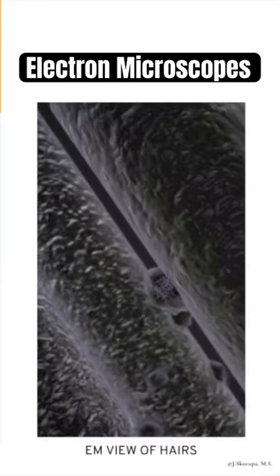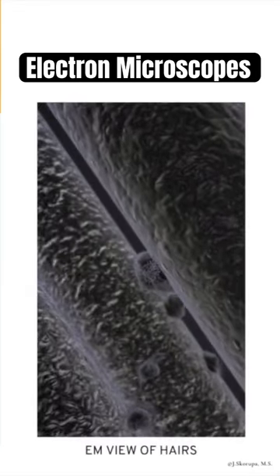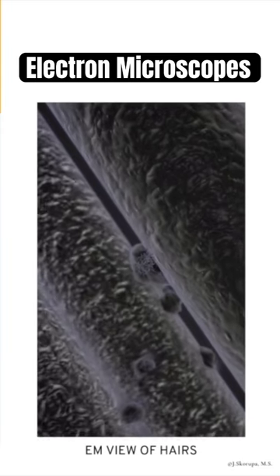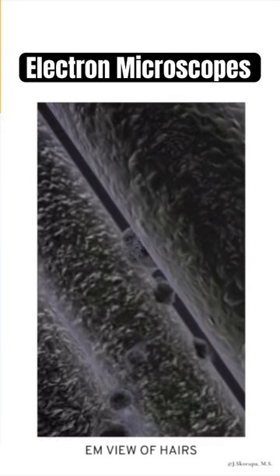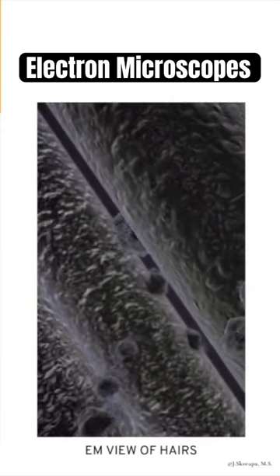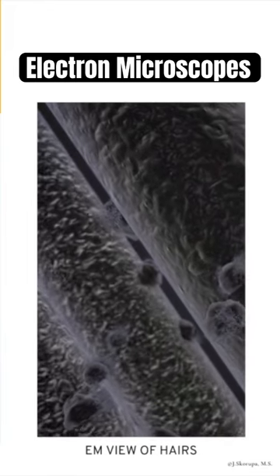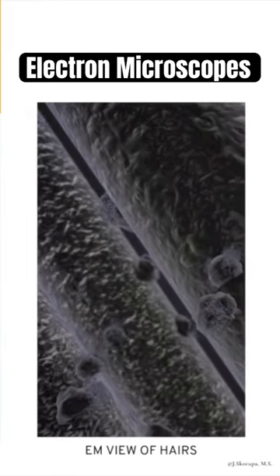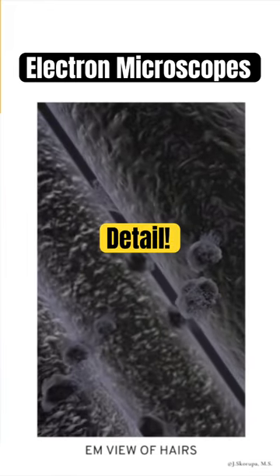Electron microscopes are very powerful tools for visualizing cells, tissues, and small organisms in very great detail.